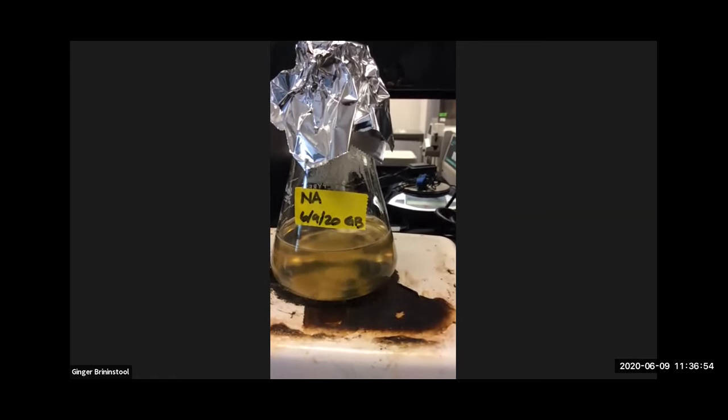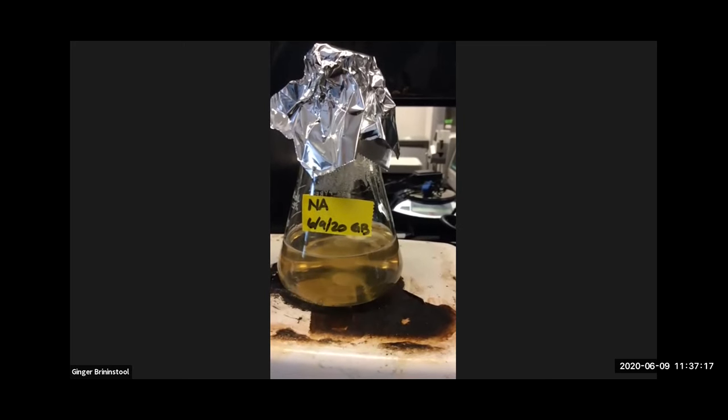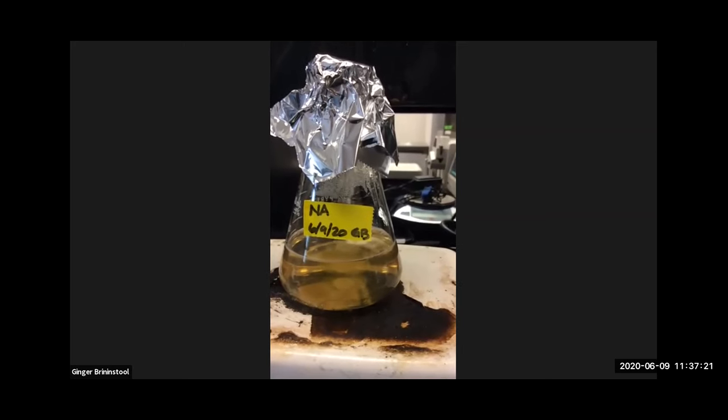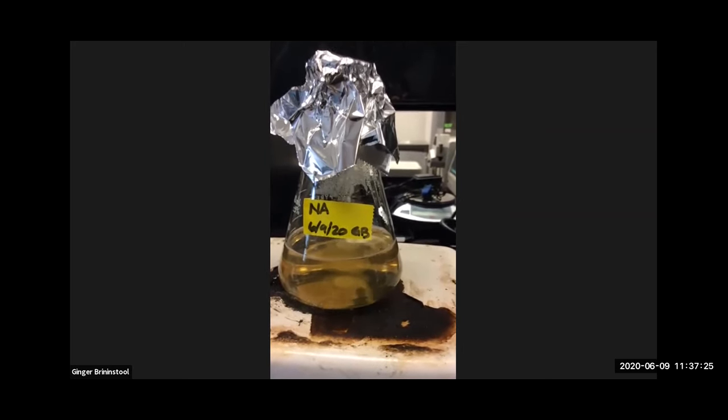So I had you guys on the schedule. It says to look through exercise 18, which is the media preparation, which we're doing now, and then experiment 6, I believe it was, ubiquity of bacteria, right? And that one's all about culturing all sorts of places.